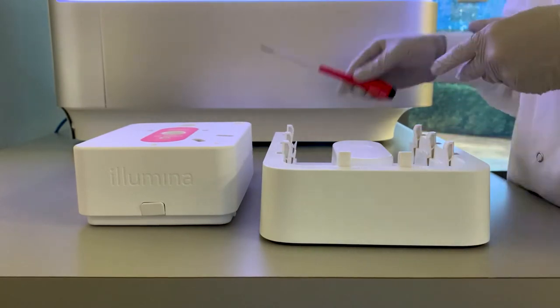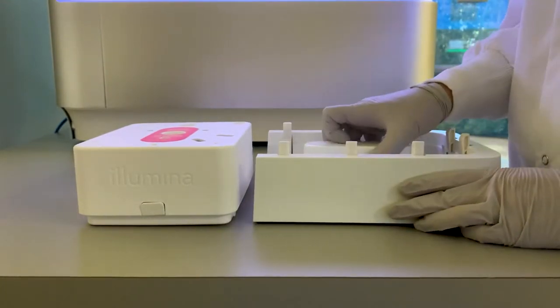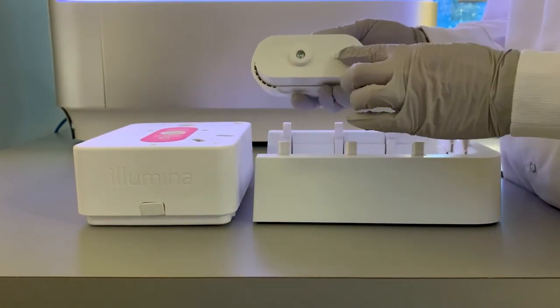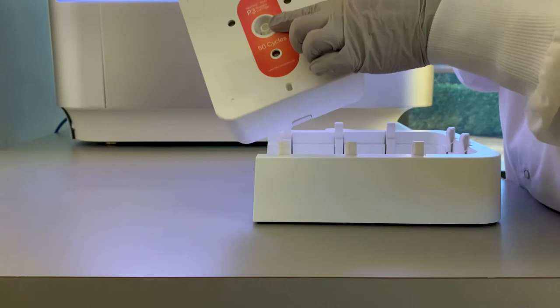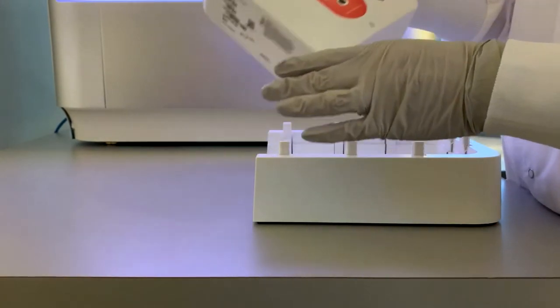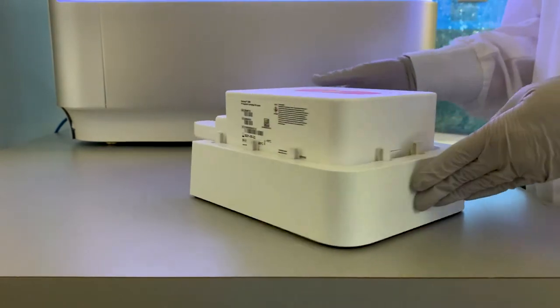Remove the punch tool from the base of the fixture. Rest the cartridge on top of the fixture's pry bars, aligning the cartridge with the two rear pry bars. It is not necessary to push the cartridge down. Position the wider edge of the recycling tool fixture parallel to the bench top.